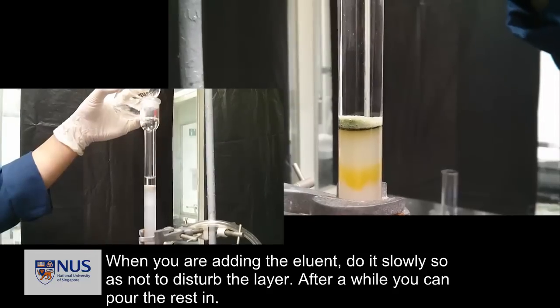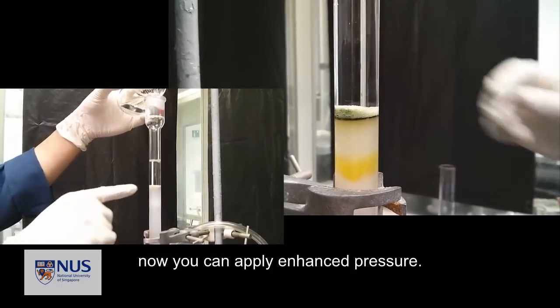After a while, you can pour the rest of the solvent in, and now you can apply the enhanced pressure.